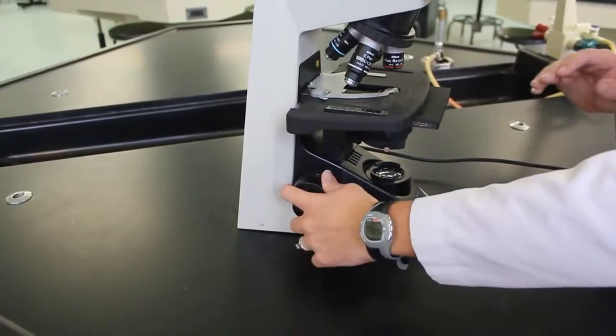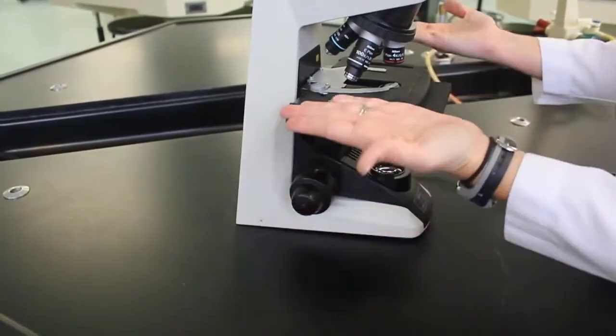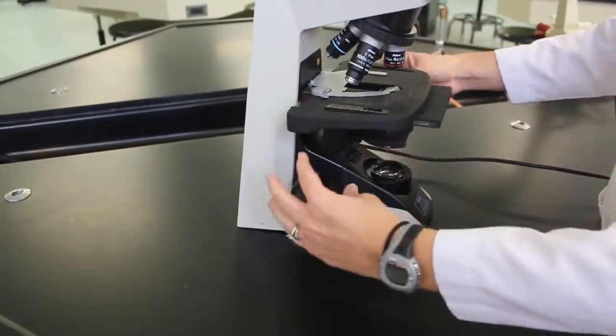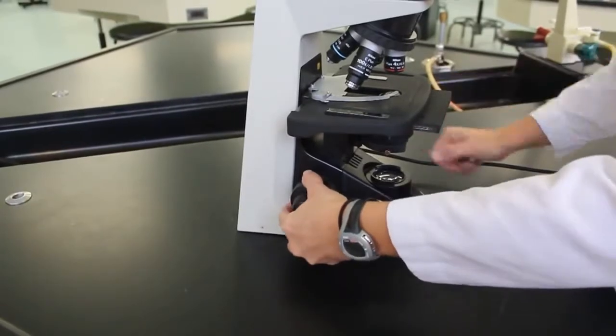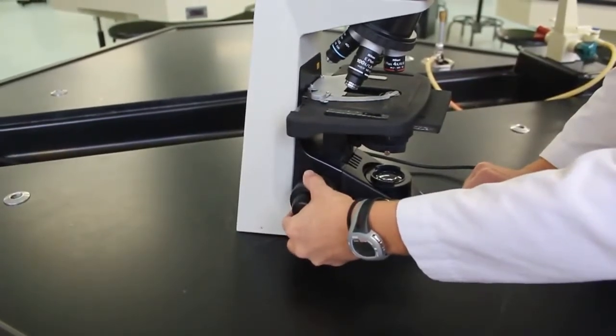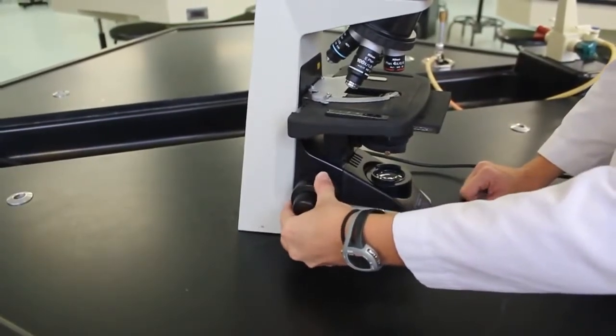You should always start with the stage completely up, meaning you have turned it as far away from you as it will go. That way, as you're focusing, you only need to turn the knobs towards you.